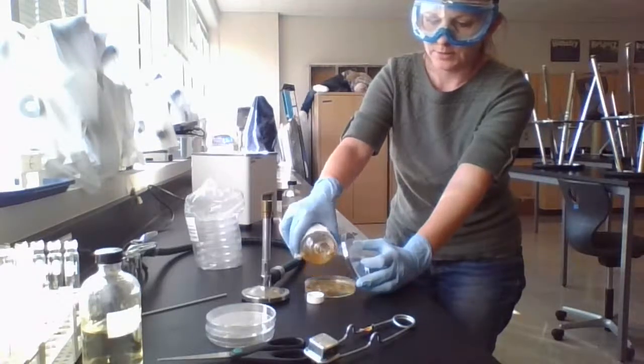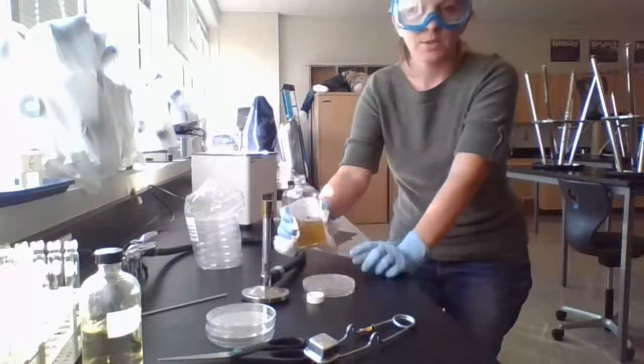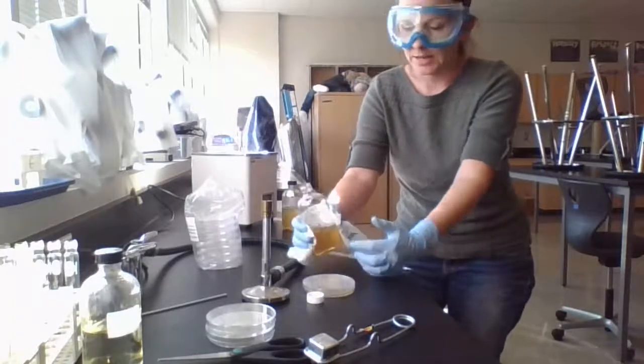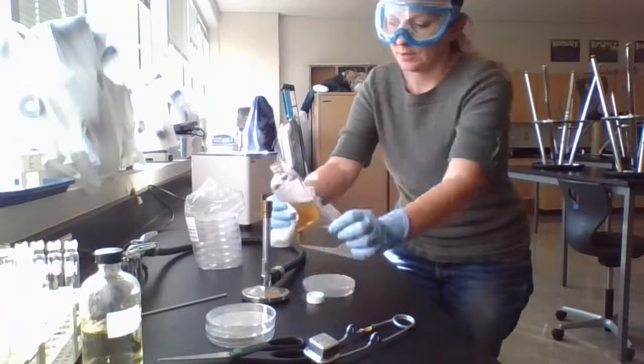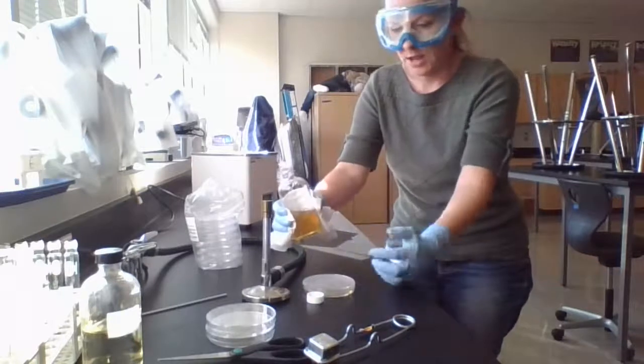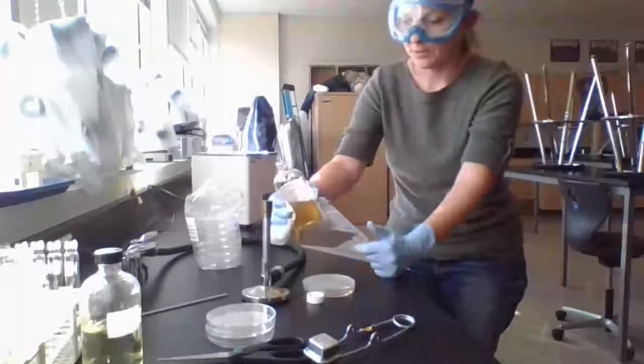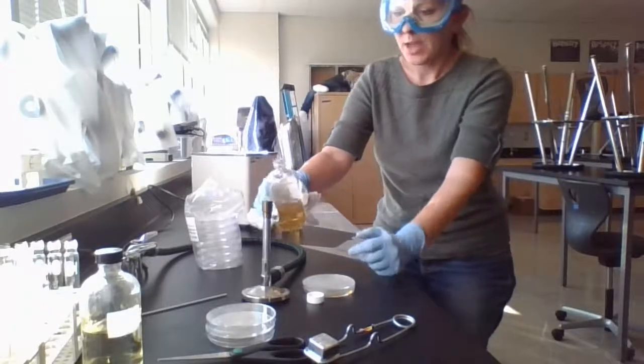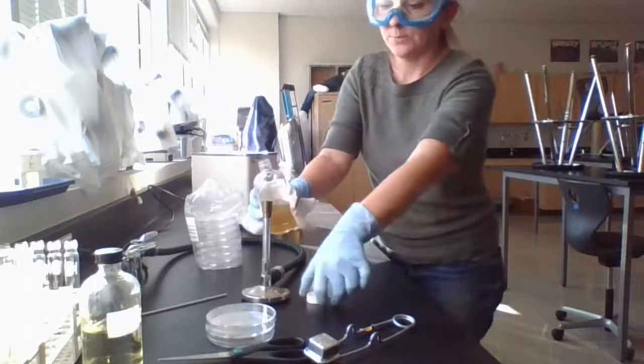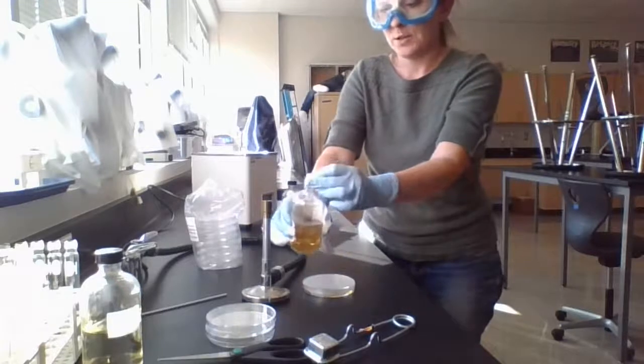Now this is actually a little bit, this isn't quite as liquidy as I'd like. There's some agar that's not fully melted. For our purposes today, it'll be fine. But typically, I would let this melt a little bit longer. Okay, and then when I want to put the lid back on, you just pass it through the flame one more time and put the lid on.